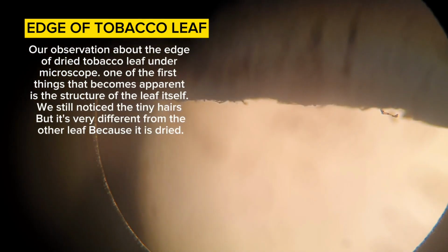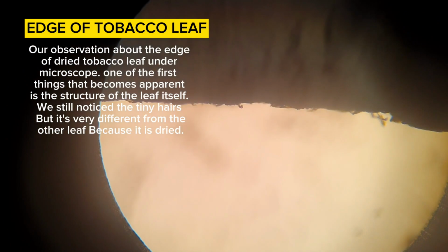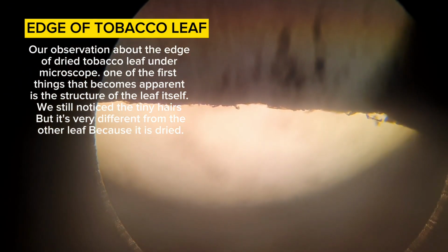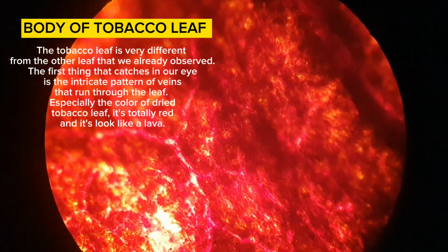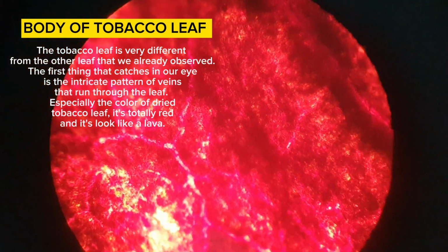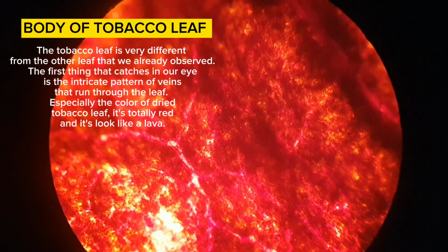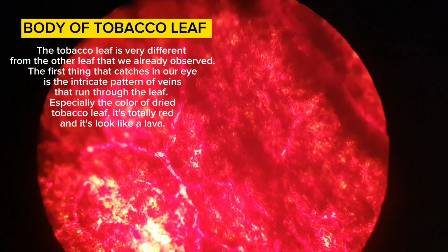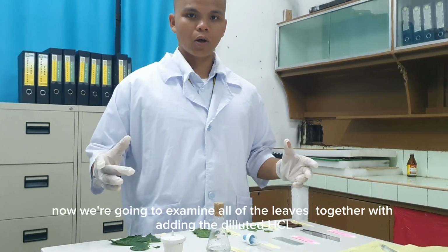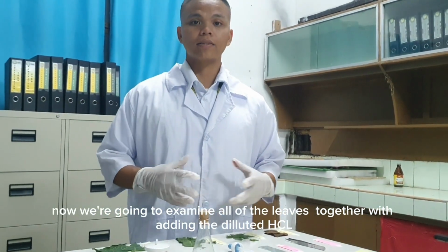Our observation about the edge of a dried tobacco leaf under the microscope: one of the first things that becomes apparent is the structure of the leaf itself. We still notice the tiny hairs, but it's very different from the other leaves because it is dried. The first thing that catches our eye is the intricate pattern of veins that run through the leaf, especially the color of the dried tobacco leaf. It's totally red and it looks like lava. And now we are going to examine all of the leaves with diluted HCl added.